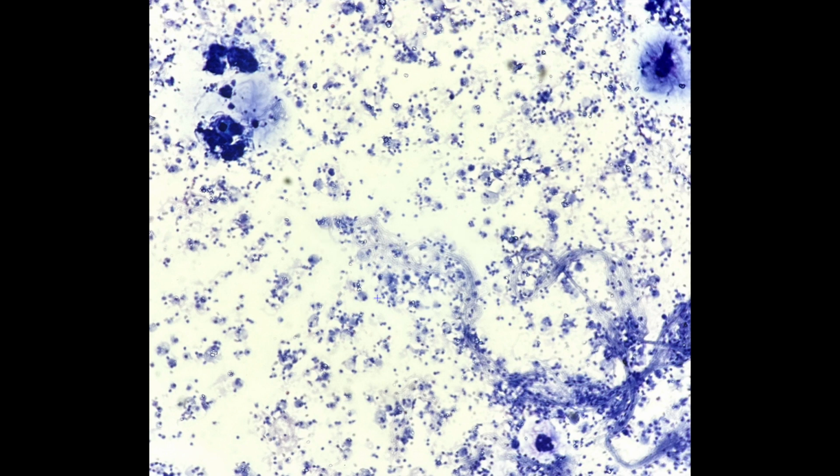Ascites. Again, we'll see mesothelial cells, histiocytes, lymphs. This is a 70-year-old patient with bloody ascites with a concerning mass in the colorectal region. They did a washing in the peritoneum, and from the get-go, you can see these clusters of 3D cohesive groups with this kind of stringy acellular material that reminds you of mucin.